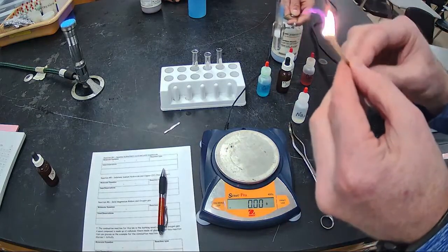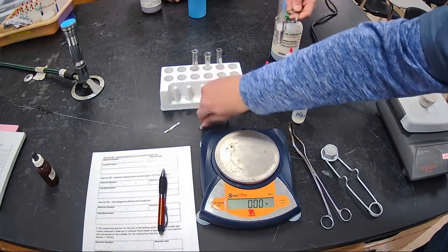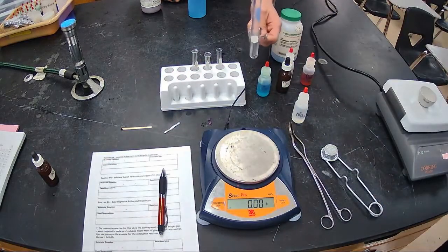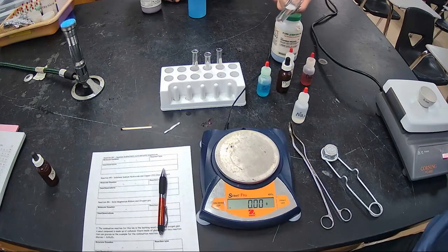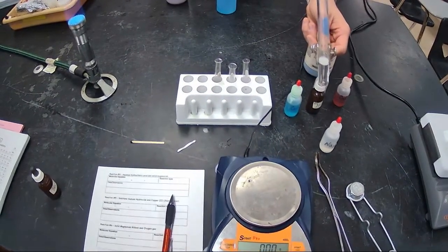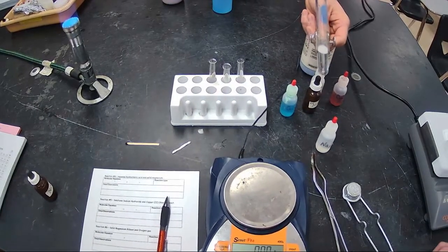There's glucose in that wooden splint, some carbon, hydrogen, oxygen, and we're burning that as part of a combustion reaction. And then we just ignited the gas that's in here. You can see there's still gas being made too. That gas is very flammable, and because it's flammable, we ignited it with the wooden splint. So you can see that gas is still being generated until the magnesium is all used up.